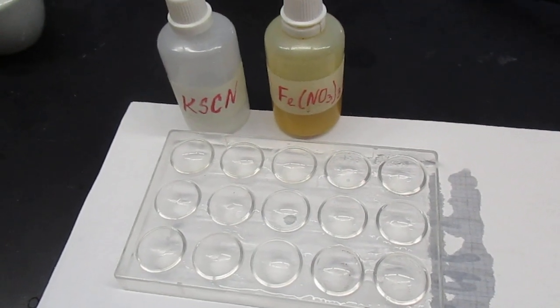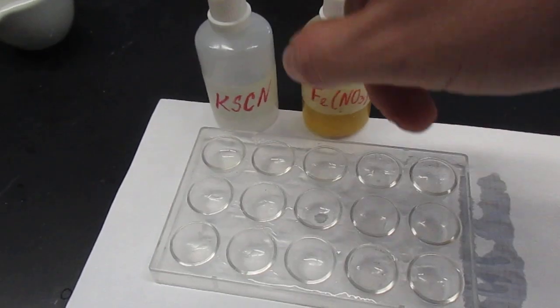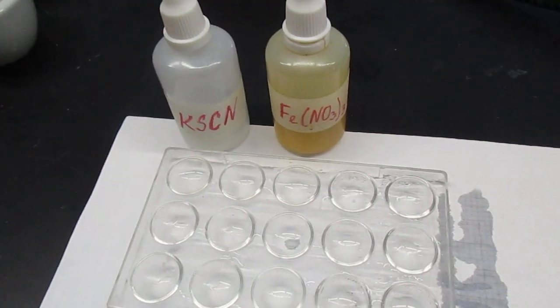For this part of the physical and chemical change activity, we're going to be looking at what happens when we mix these two chemicals together.